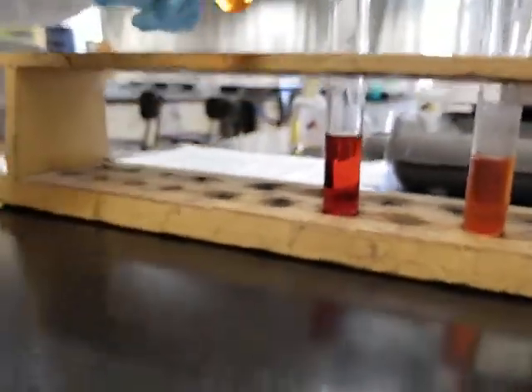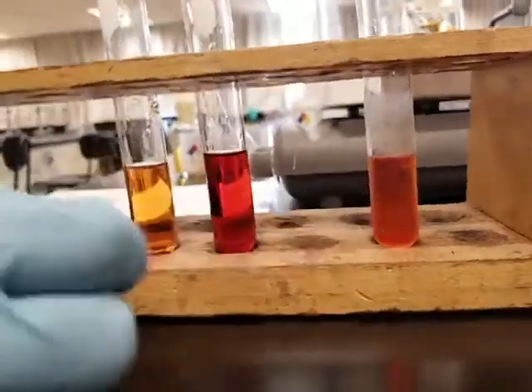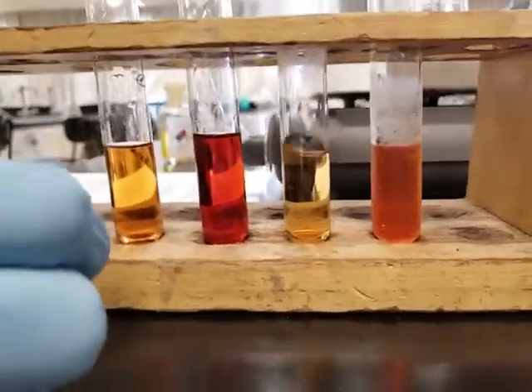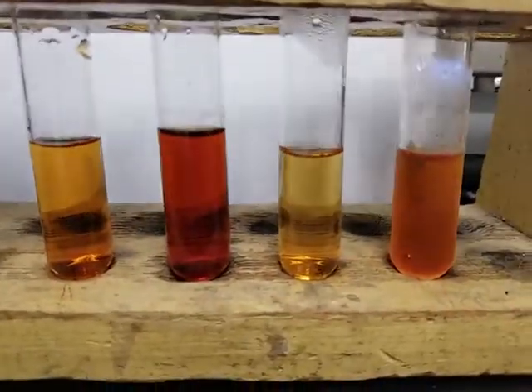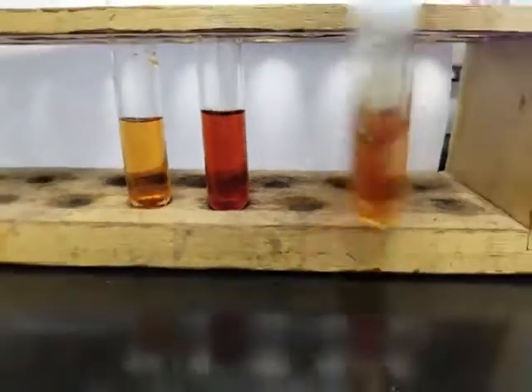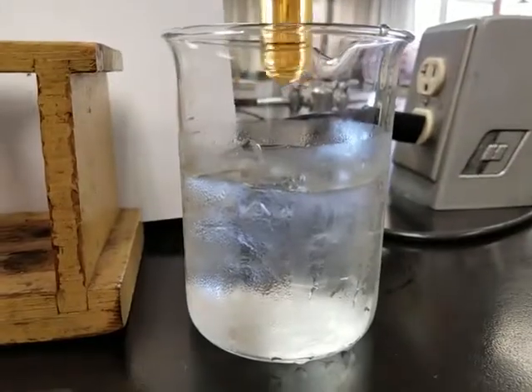All right. That was test tube 4. So with that, I think it's also a good idea. I'm anticipating this to actually have a color change. So let me just take this one that was heated. You guys see this one that was heated? All right, this is the one that was heated. And then we're gonna just cool it back down and see if we can get any change. Okay, we're gonna cool it down a bit. And then let's dip it in just for fun. All right, just dip it in. See what happens.